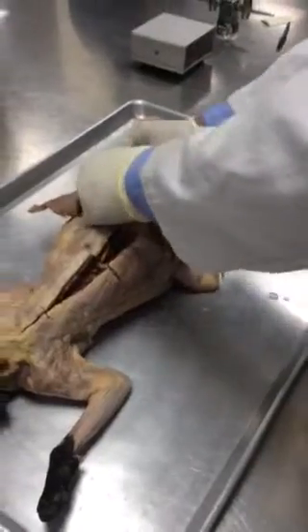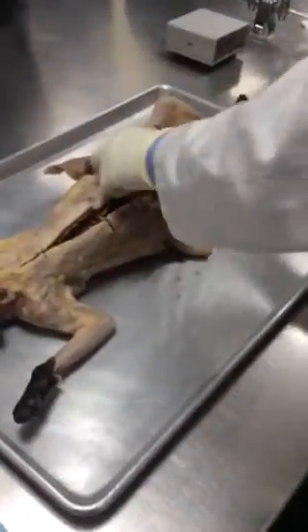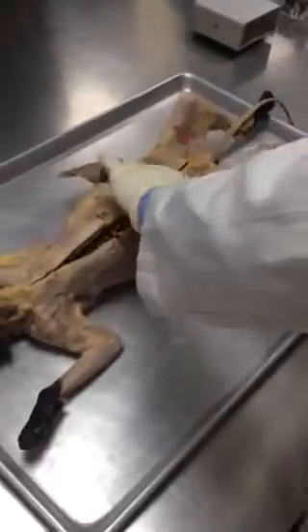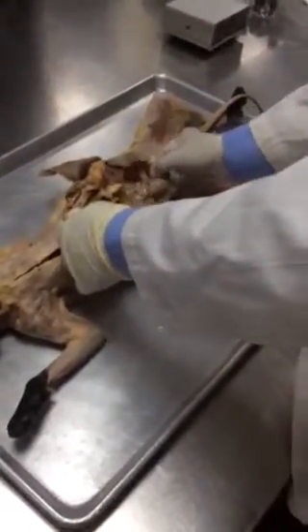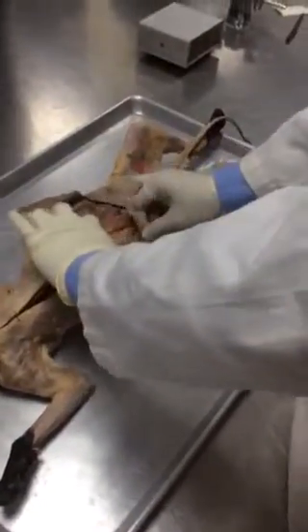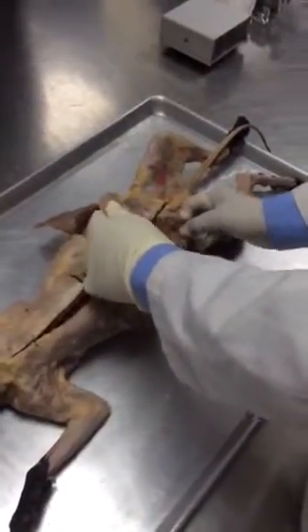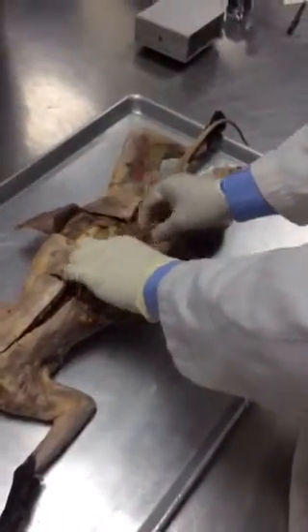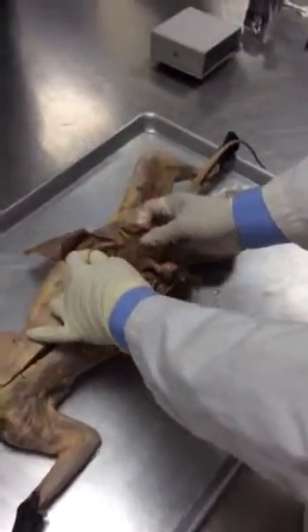So I am actually carefully removing the thing. You see, it is like covering the intestine, like the mother covers the baby, right? Like a blanket. So you see, now this is the omentum. And now here you see the small intestine, right? How do I know this is small intestine? Because it is very long and it doesn't really look that wide. So the caliber is not so big. So it's the small intestine.